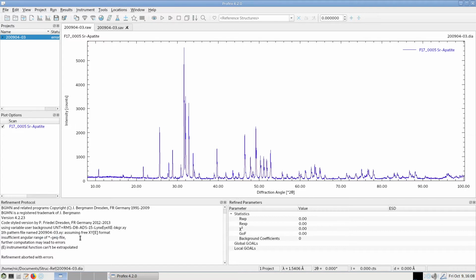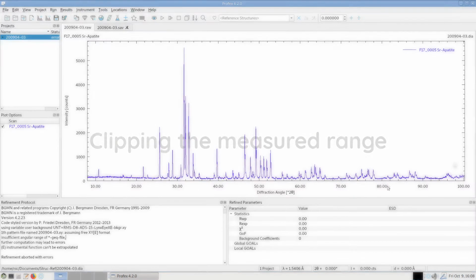Now there are two possibilities to solve this problem. We can either just clip this range and only use the data up to 80 degrees, for which we have a valid configuration, or we can extend the configuration all the way up to 100 degrees or more. And I will first show how to clip the data and only use data from 8 to 80 degrees.